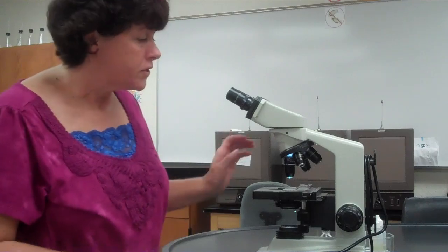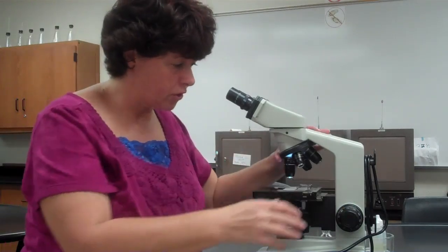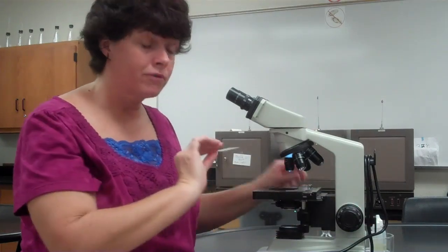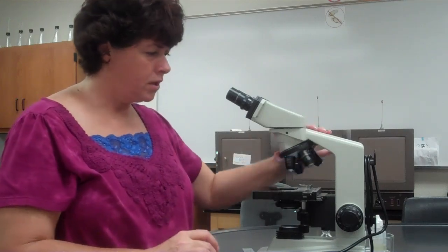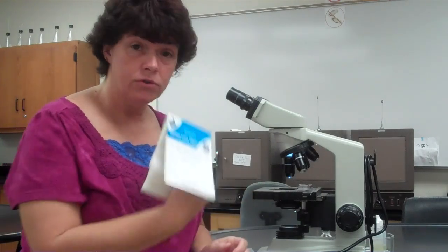So now I'm done. I found my specimens, I've done my drawing, I'm done with the slide, okay? So remember it was way up there on the 100. You're going to go to a lower power, lower the stage, remove your slide. Now, we need to get the oil off of the 100 lens. To get the oil off the 100 lens, you use lens paper.